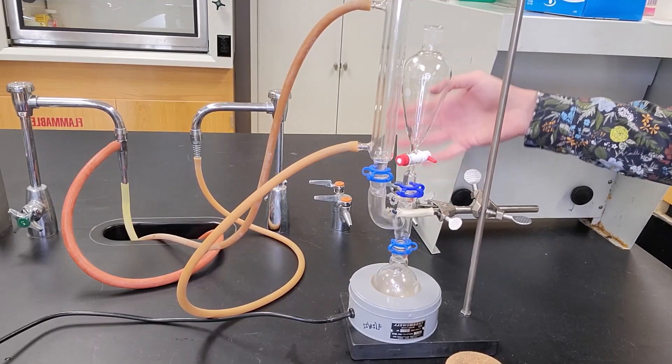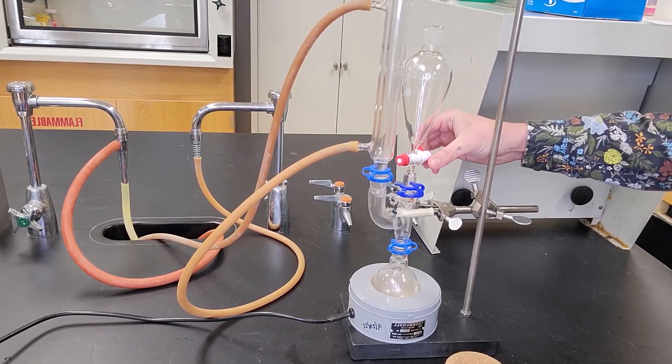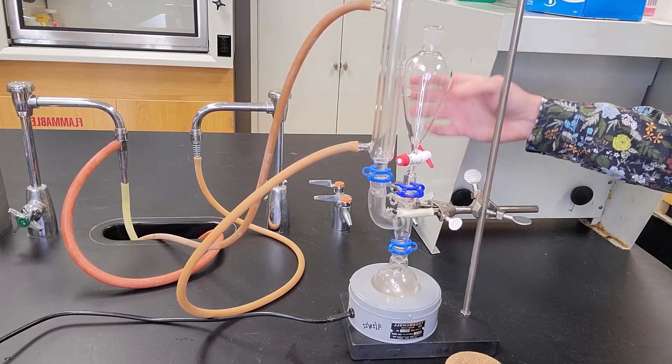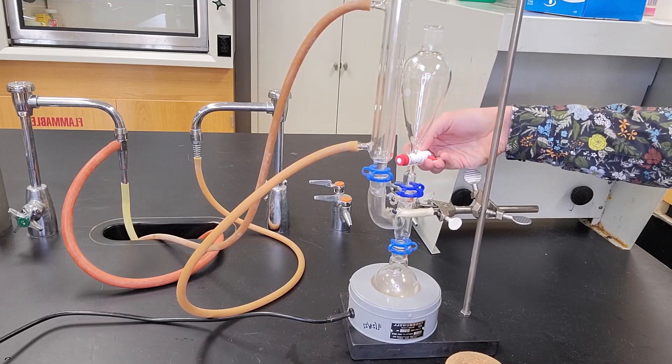If I wanted to add dropwise, I can open it just a little bit. If I want to add quickly, I can open it further. But usually if we're using an addition funnel, we're going to be adding it pretty slowly.